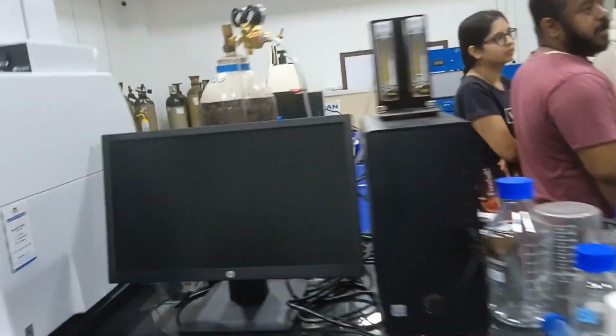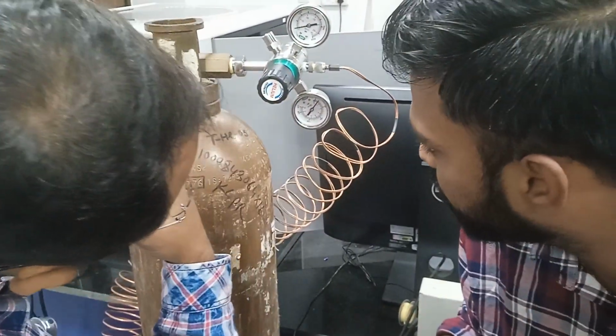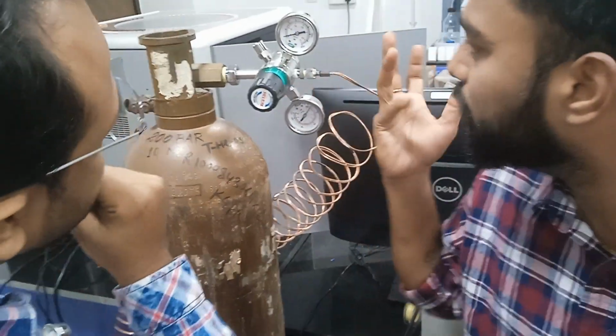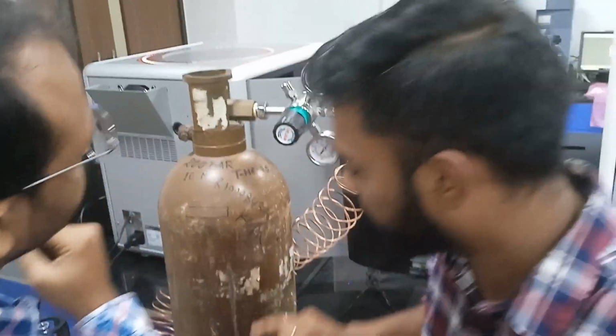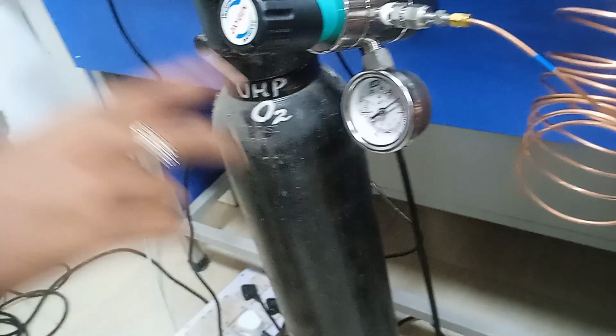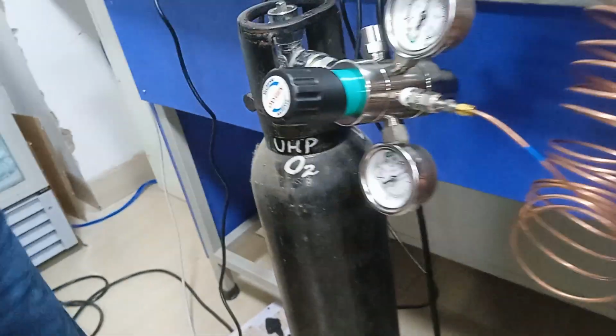This is the PSI. There are two scales as well, I think. So you can keep this one at 1.2. That is kg per centimeter square. So we'll measure and say it as bar. So this one is done. And this one, two only.